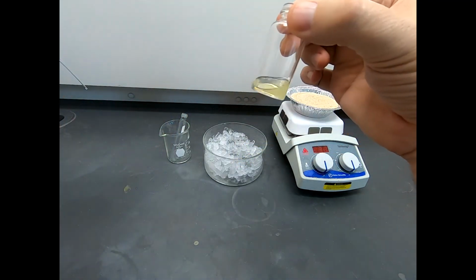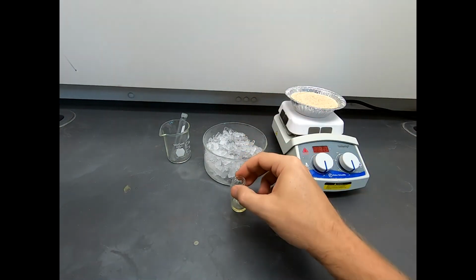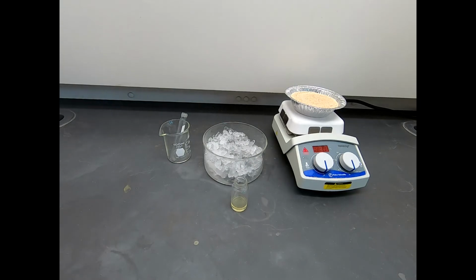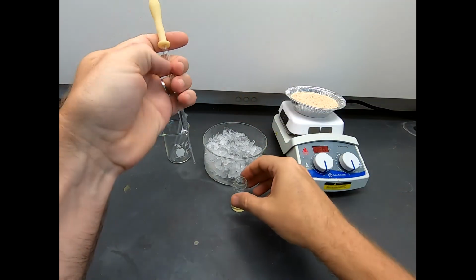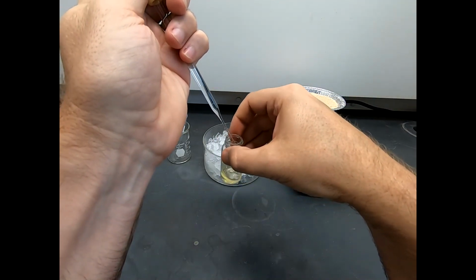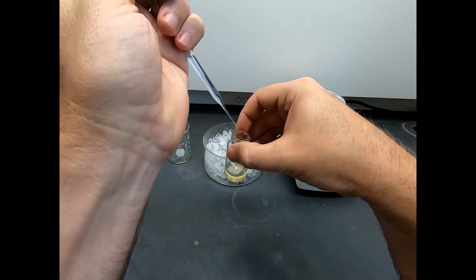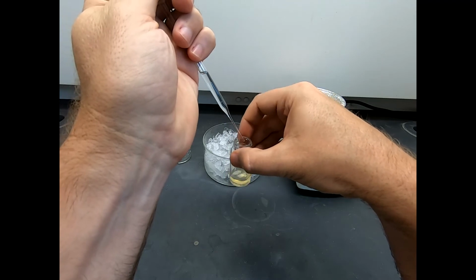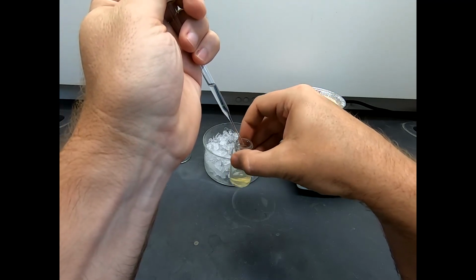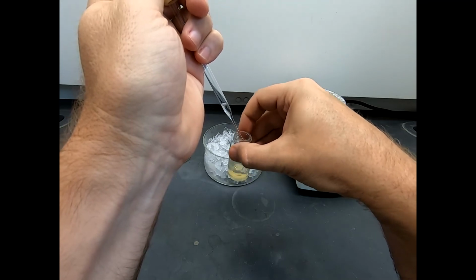Now I don't know if you can see on camera, it's looking just a little bit cloudy, a little bit turbid. So my guess is in this next addition of hexane, and that was about 2 milliliters, and I'm going to add 6, so here comes approximately 2 more. I don't know if you can see the pace, that's kind of the pace I'm going. Drip, drip, drip, maybe a little faster. Squirt it in there slowly.